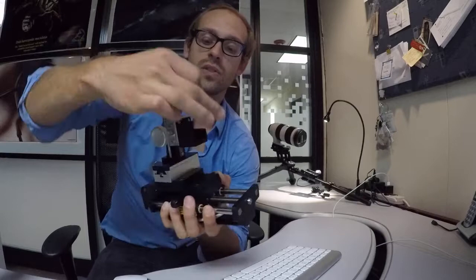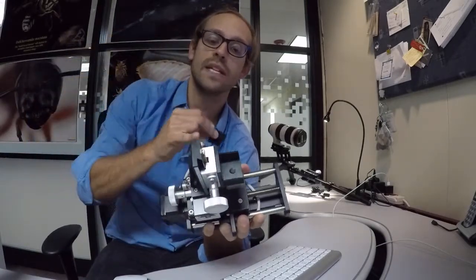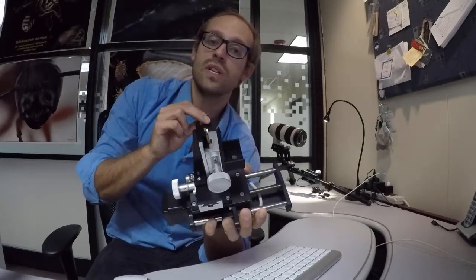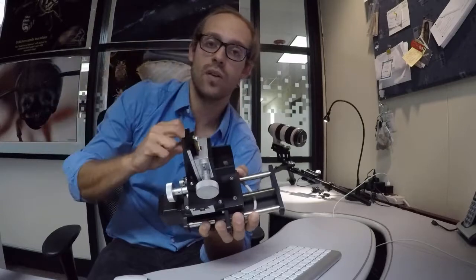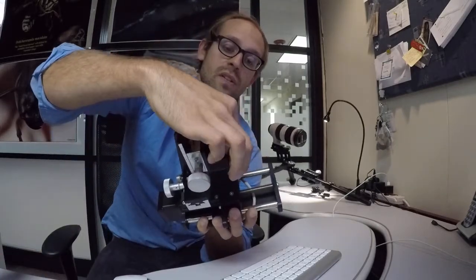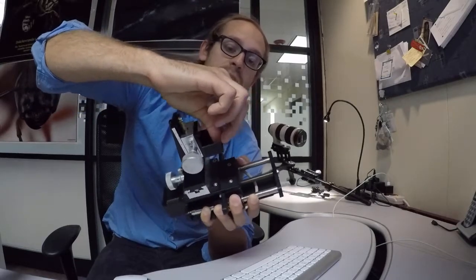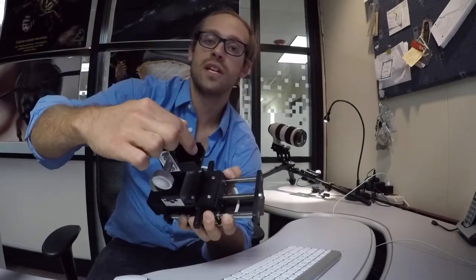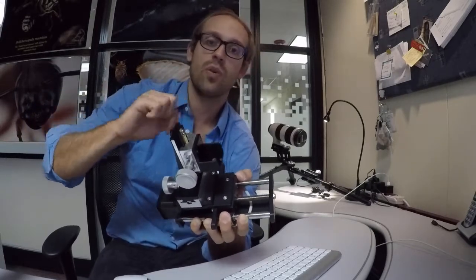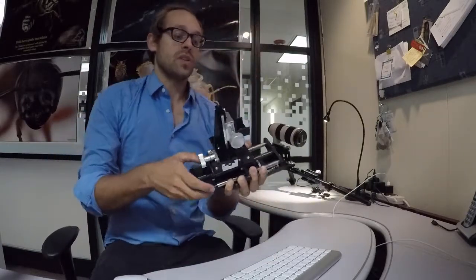If you notice I have a little dollop of clay situated right in the center of the stage so that no light can come up through the center of that hole. But when you're using the micro kit, you don't want to position your specimen in that hole where the clay is. You actually want to take some clay and put it on the very front of the stage, and then you want to pin your specimens closest to the objective as possible but without the sample coming into direct contact with wherever your light heads are positioned.